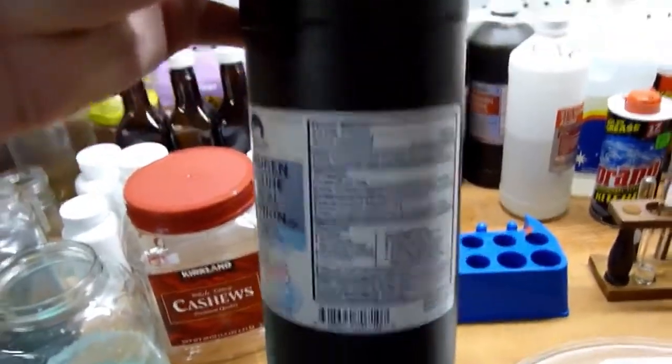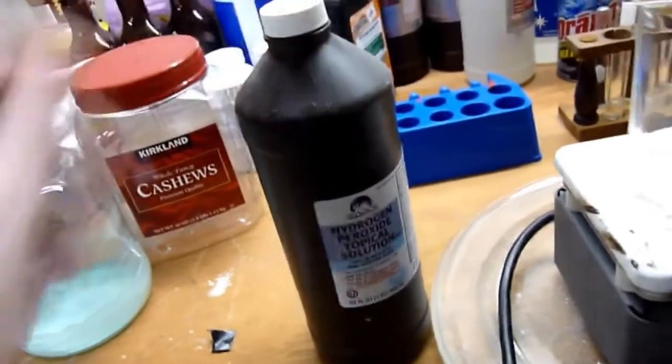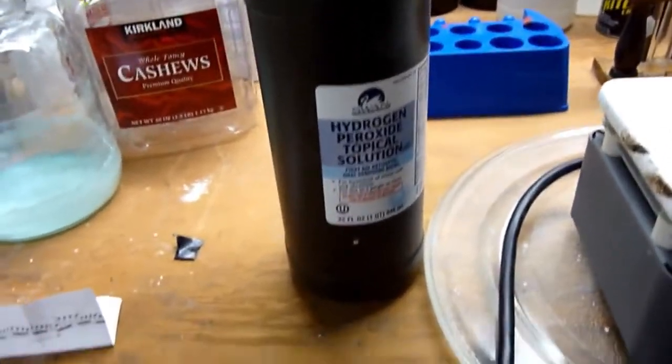So what we basically have here is 3% stabilized hydrogen peroxide that you buy at any drugstore. I know a lot of syntheses require concentrated hydrogen peroxide, so I'm going to show you how to do that.